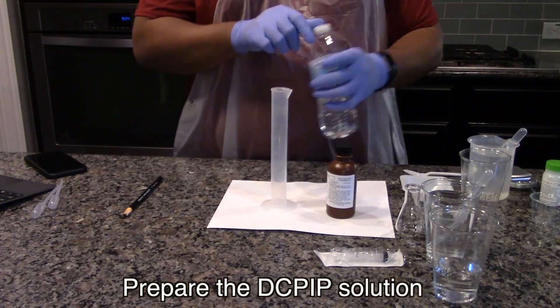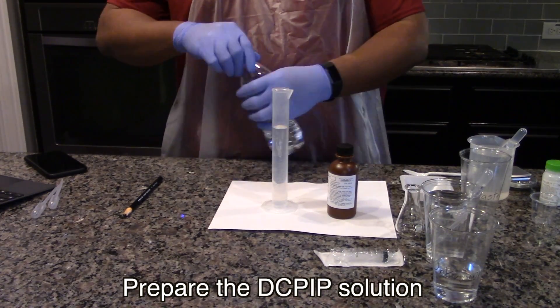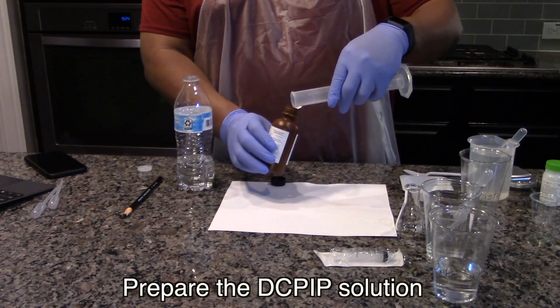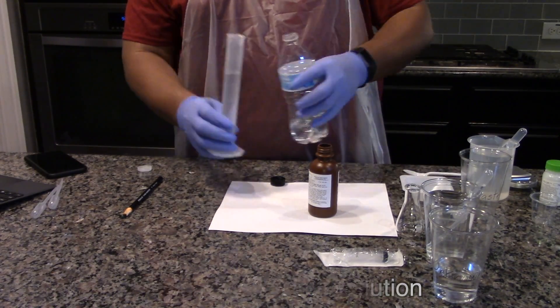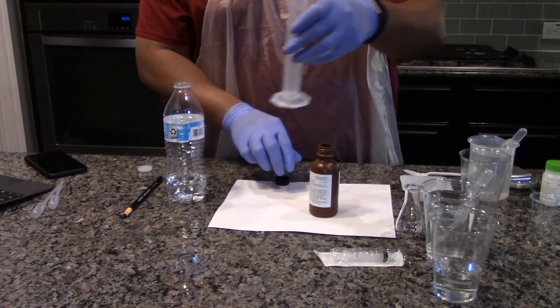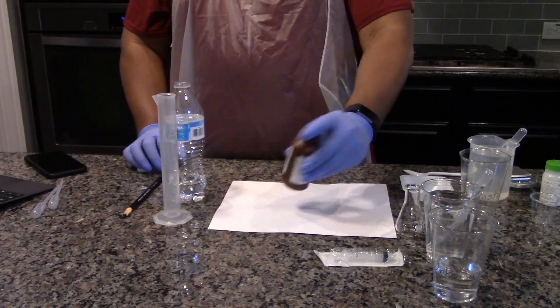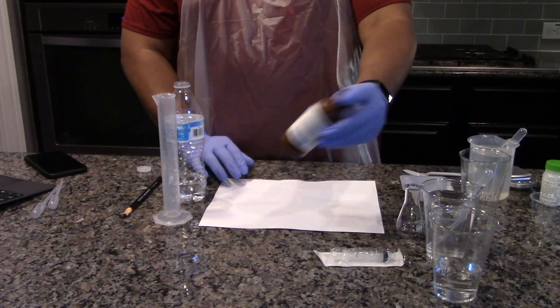Prepare the DCPIP solution by adding exactly 100 milliliters of pure water to the brown bottle. Use the 50 milliliter graduated cylinder to measure the water. Cap the DCPIP bottle and shake to dissolve.